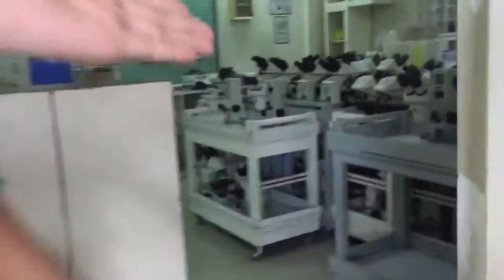Okay, hi guys. We're joined by our friend Matt. Yes, and we're going to show you the microscope. Come on, let's go. So we're here in the stock room. As you can see, there are different types of microscopes that we use in different biology subjects. So today we're going to show you how to use it and what the parts of it are.